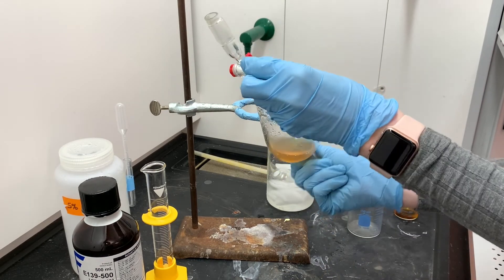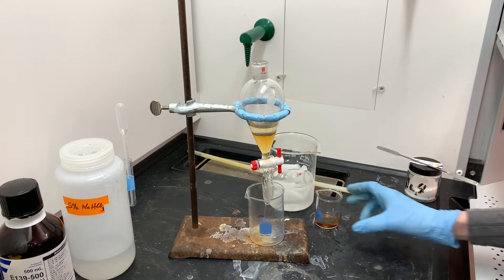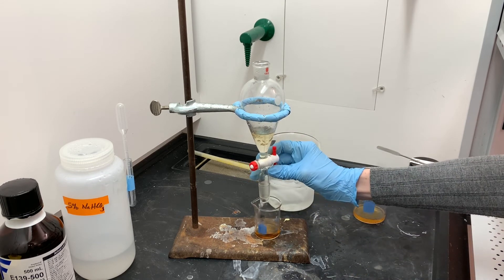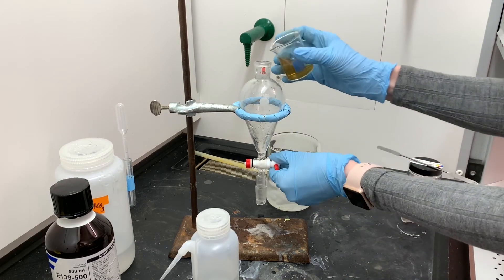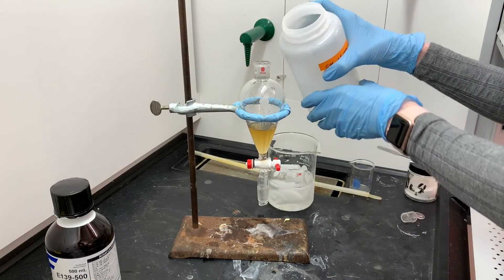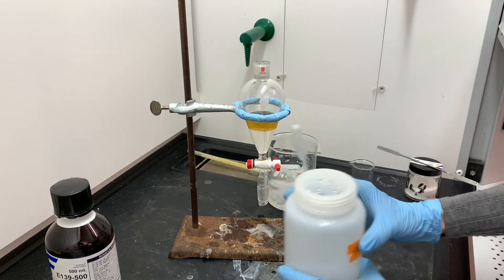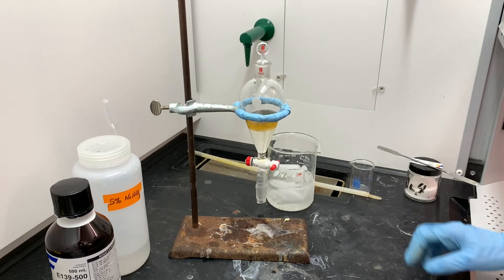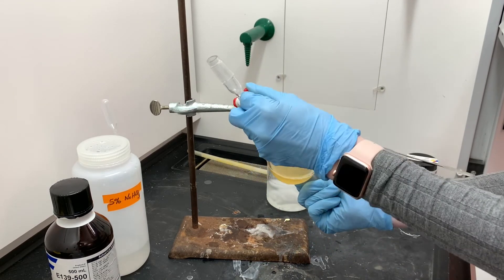Notice this time the top layer is a really different color — that means the first extraction was very successful and most of the product got removed in the first extraction. Once again we wait for a good, clean separation. The bottom aqueous layer comes out as waste. Then I'll take that organic layer and add it to the first organic layer — mixing the two organic layers together. Both organic layers go back into the separatory funnel for one last extraction, this time with 5% sodium bicarbonate solution. We're deprotonating the product in case some of it happened to be protonated. There's a little bit of bubbling going on.